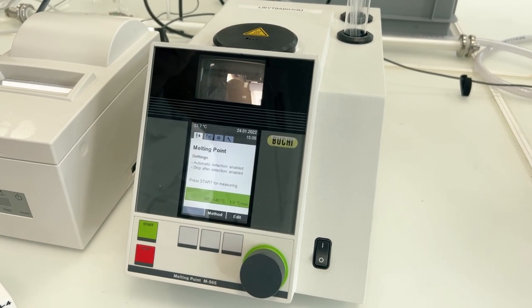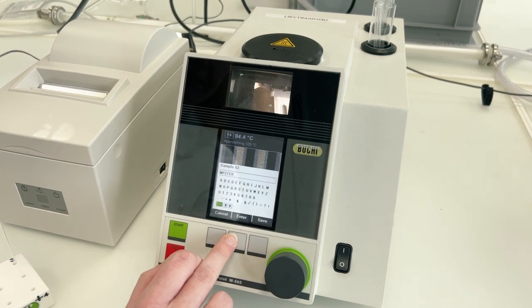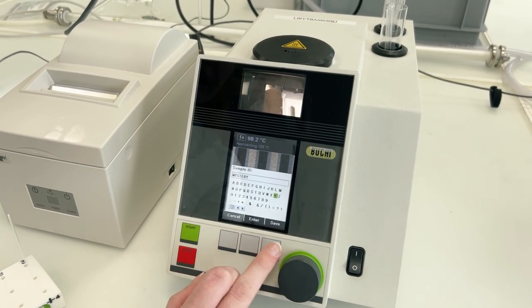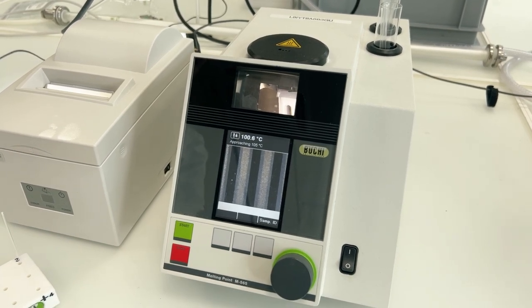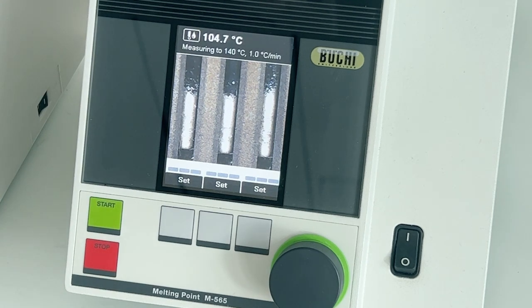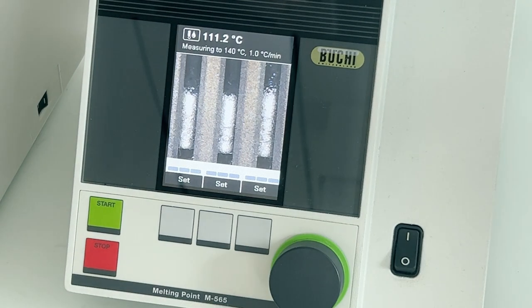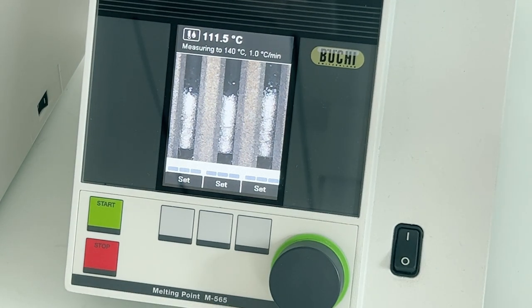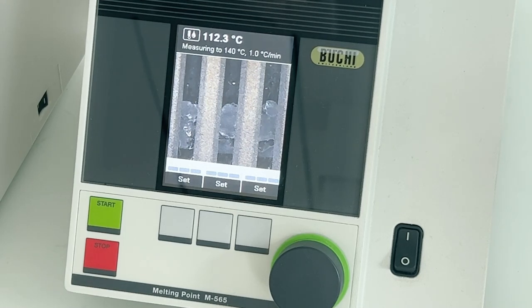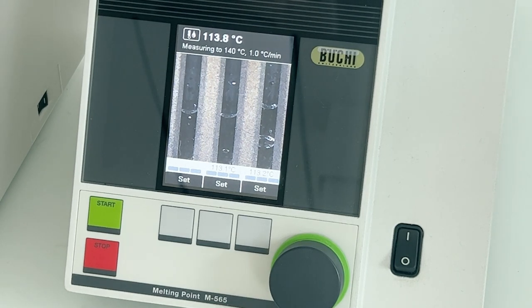To start the measurement I press start. I'll name my sample 'mystery', enter the name, and save it. The device is now approaching the target temperature. I insert the sample and press start — the heating block begins heating the sample. The sample is starting to melt. There is a camera inside that continuously monitors any change in the sample, so I don't need to stand next to it — everything is automatic. As you can see, the sample gets clearer and clearer as the melting process progresses.